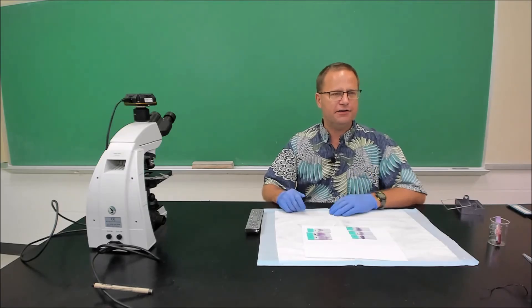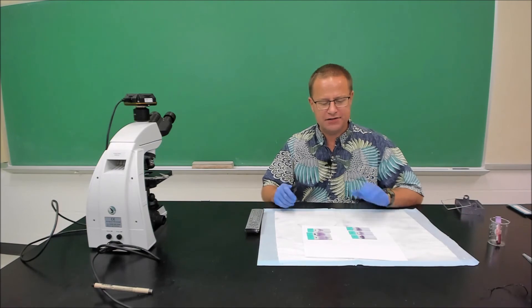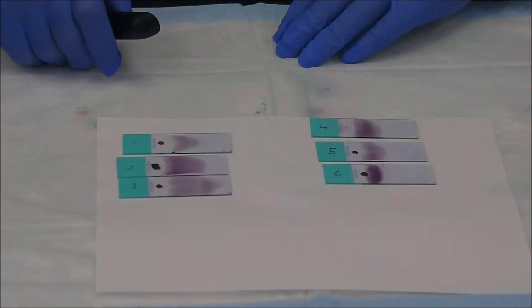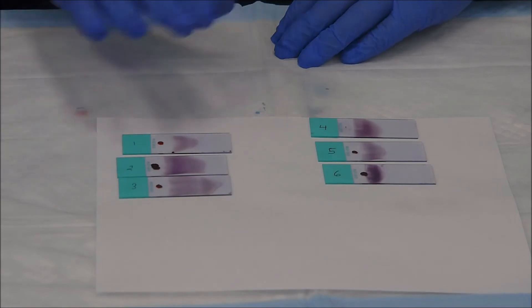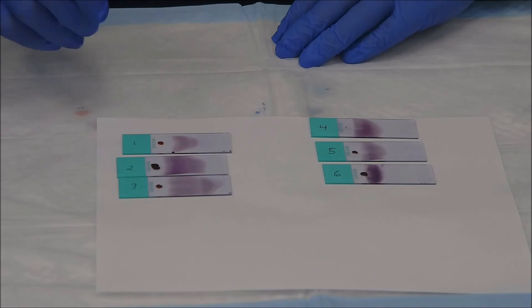Okay. So we've now had about ten or fifteen minutes for our blood slides to dry. Now let's take a look at the results. So what you can see is we've stained about five or six different slides here. And what I want you to notice is none of these are actually what we would call histopath quality. I don't do this enough. But the other thing is some are better than others.